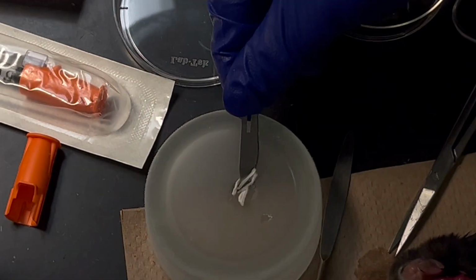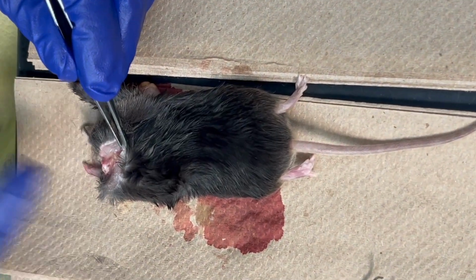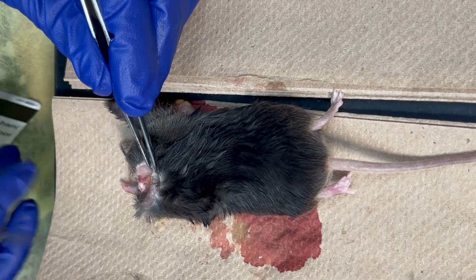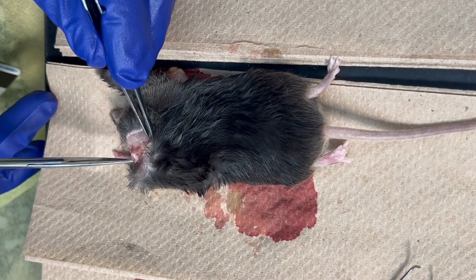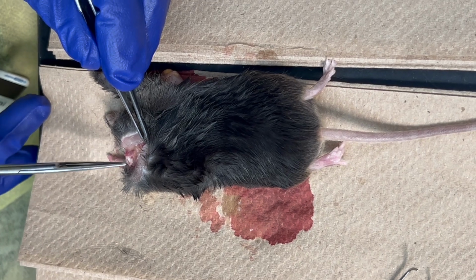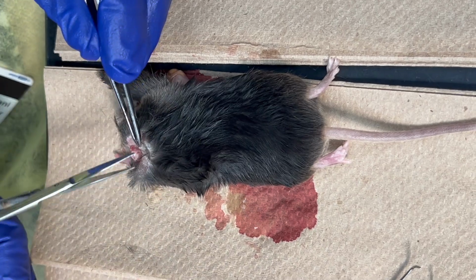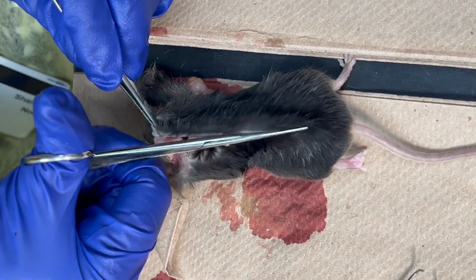Yeah. And then a good question. When you cut, it would come out very easily because the diameter here is larger, right? But when you ask where I put the needle, ideally that's where the spinal cord should be. So it's easier to see here, but on the other side it's a tiny white dot. Okay. And I will show you. Maybe that's where I was getting confused.